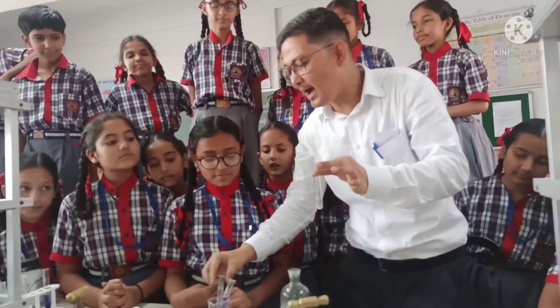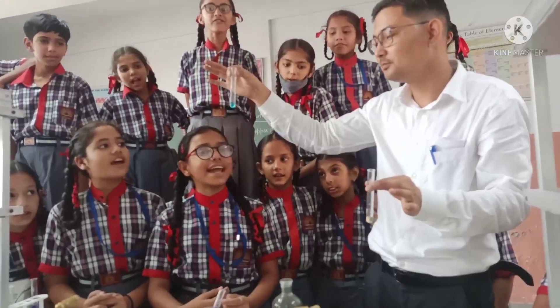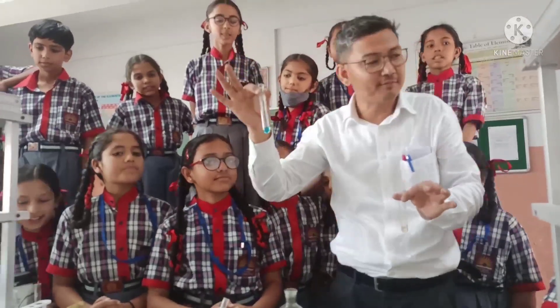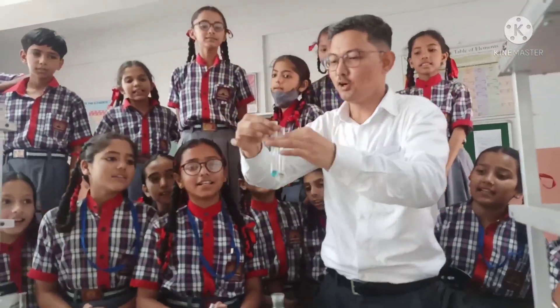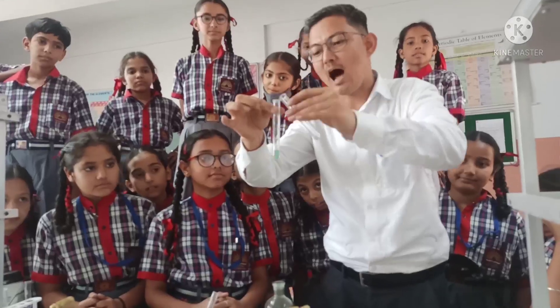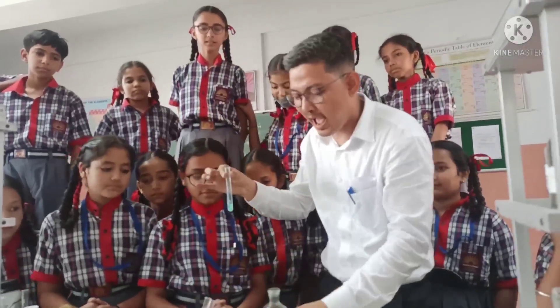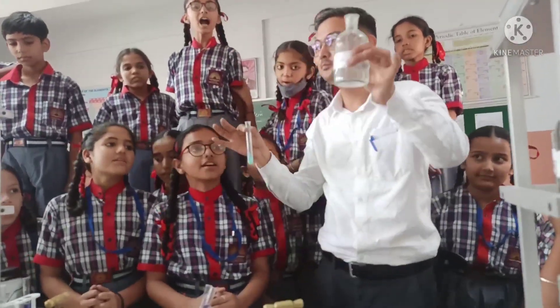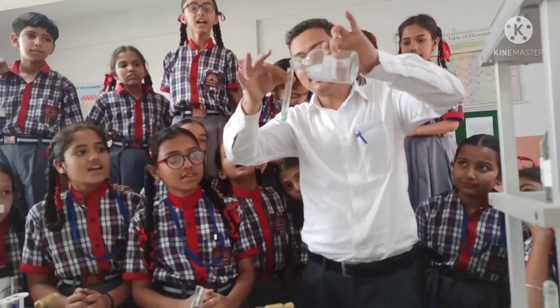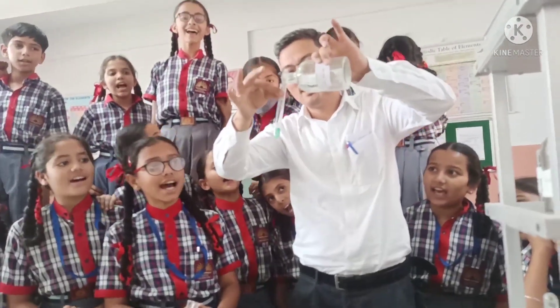And then we add copper sulfate solution. After adding the copper sulfate solution, we add caustic soda. What we add? Caustic soda.